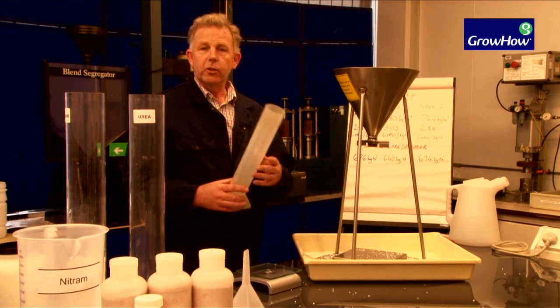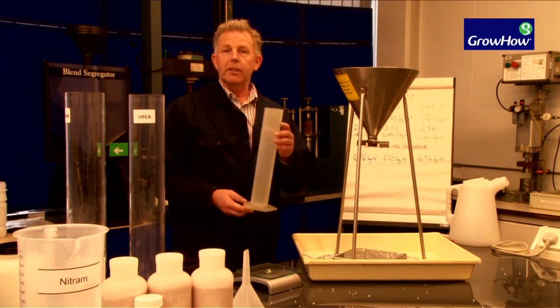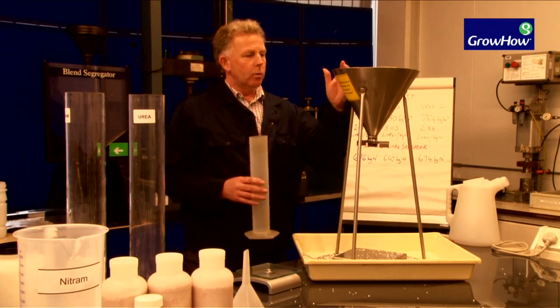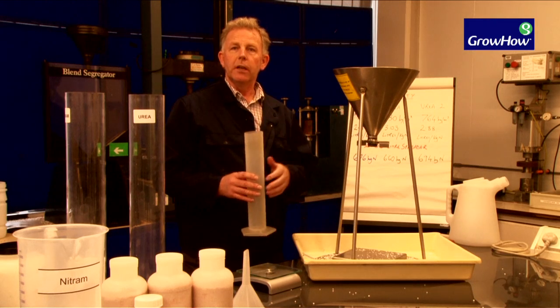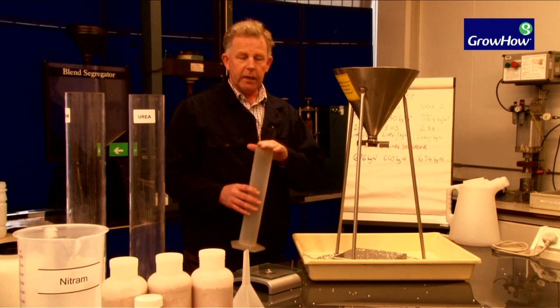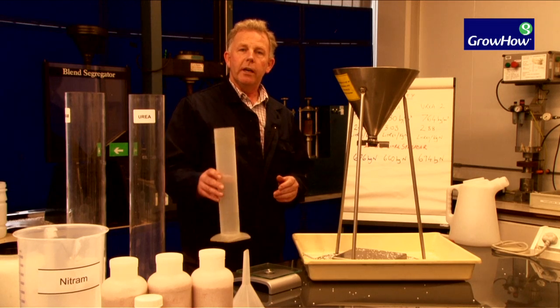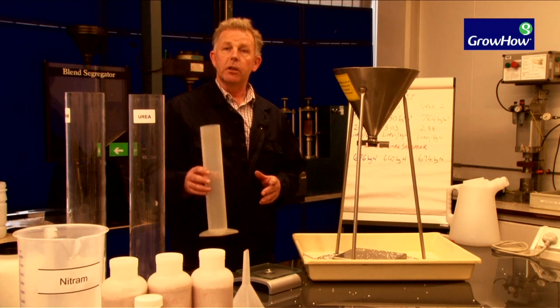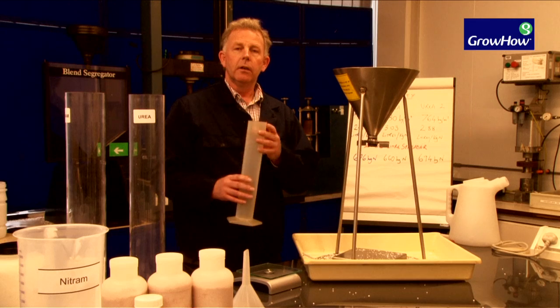Here we have simply a cylinder that's exactly one litre. We will metre the product into the cylinder so we have exactly one litre, then weigh the litre to see what it is in terms of grams per litre.